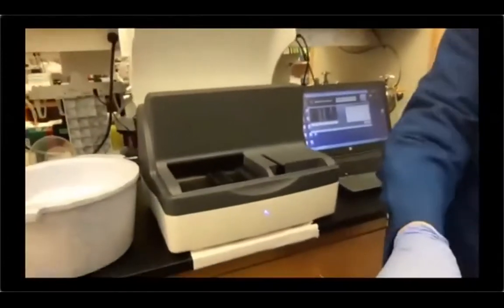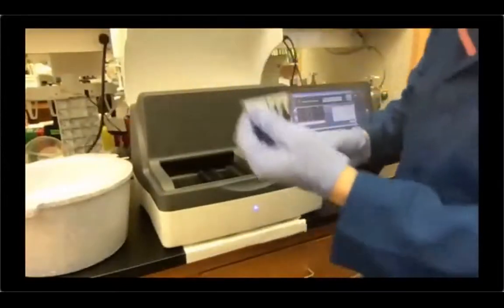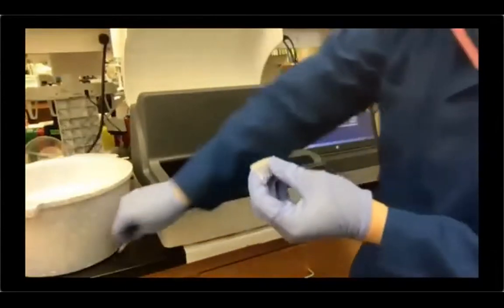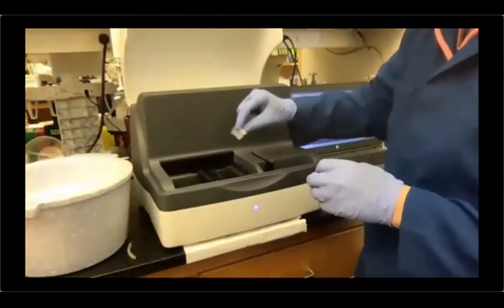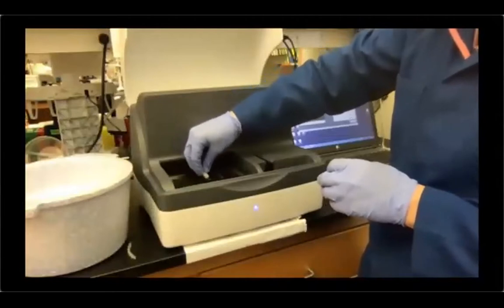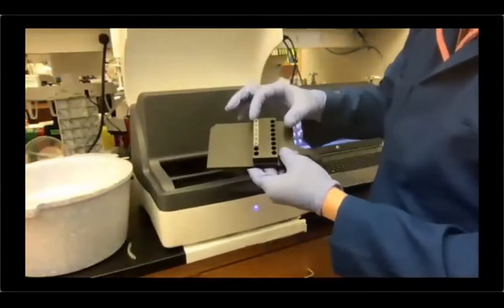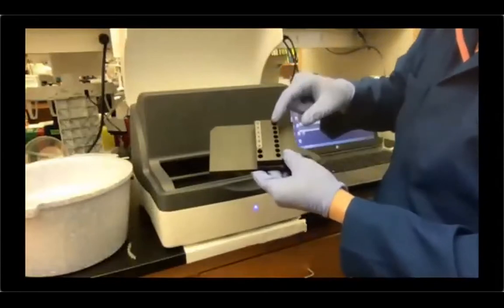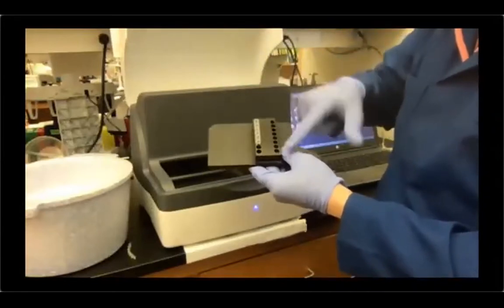So in order to do that, let's get our samples that have been in ice for at least a couple of minutes. The first thing that I usually do is I remove the caps. The TapeStation doesn't remove the caps for you. If you forget the caps, that's a $30K mistake. So please remove the caps before putting your samples in. There is a directionality, actually. This is well A1, so sample number 1 usually goes here. Then 8, 9, 16, or again, A1, H1, A2, H2, okay?